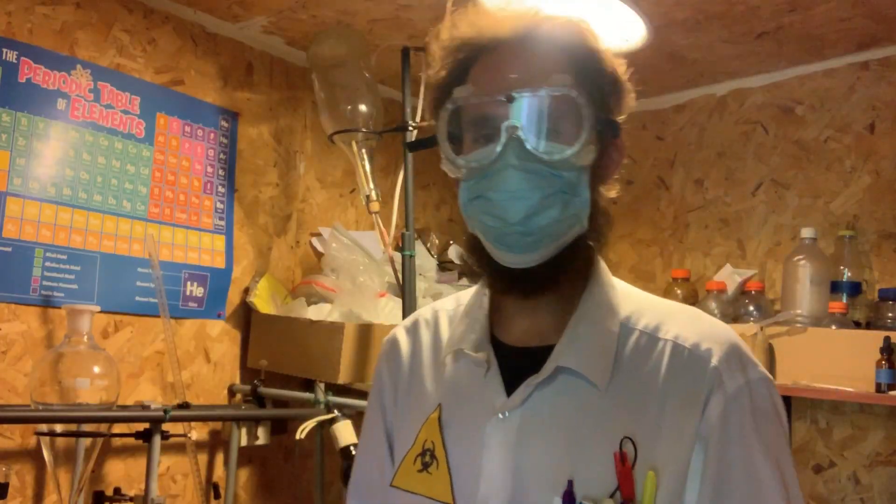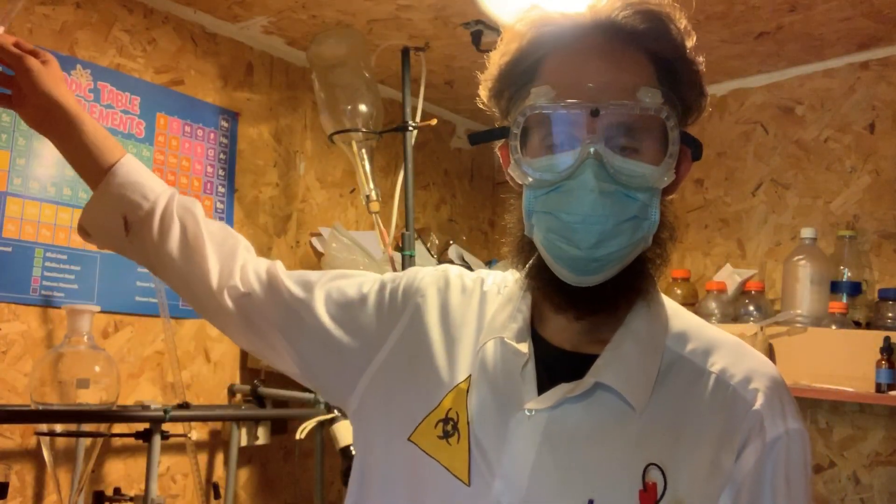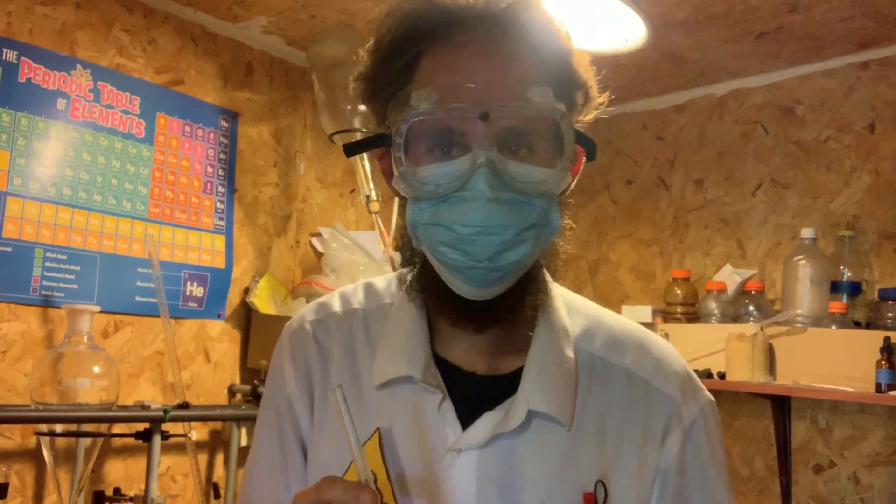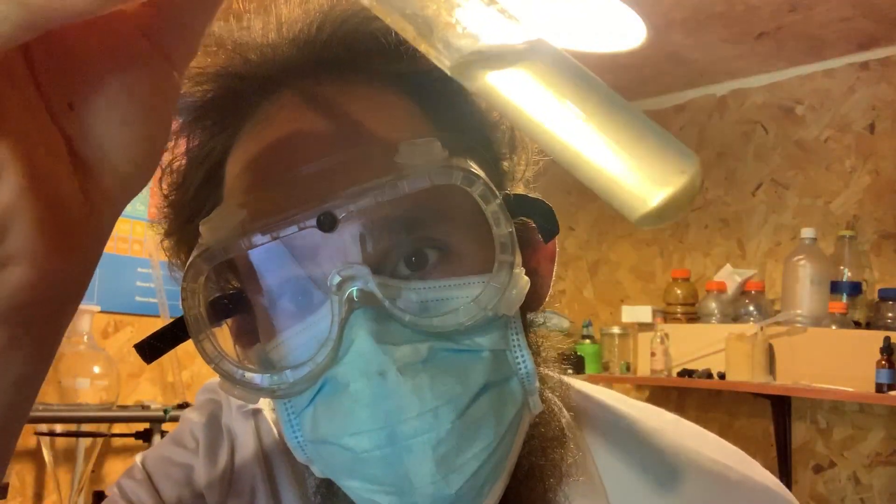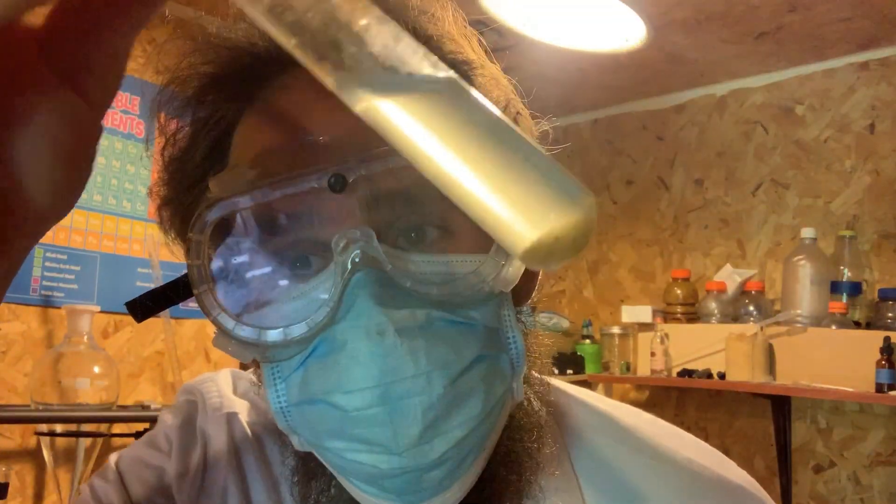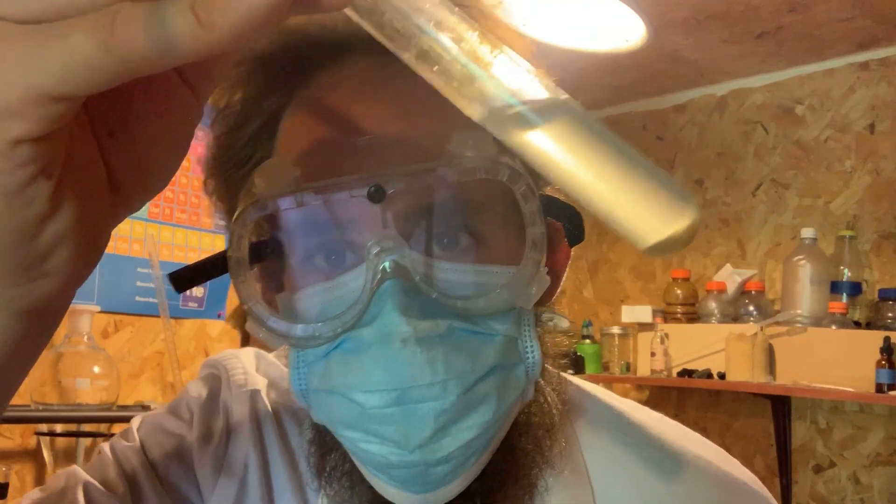Now I'm going to remove the test tube from the clamp and look very closely. What do you see? This bottom layer down here, what is that? That is our bromoform.